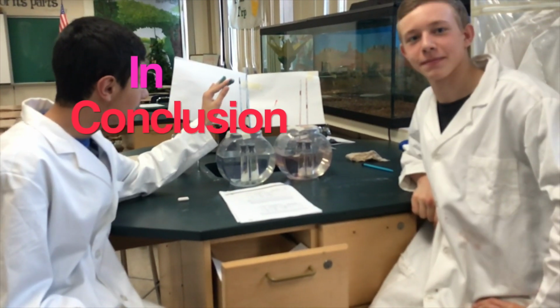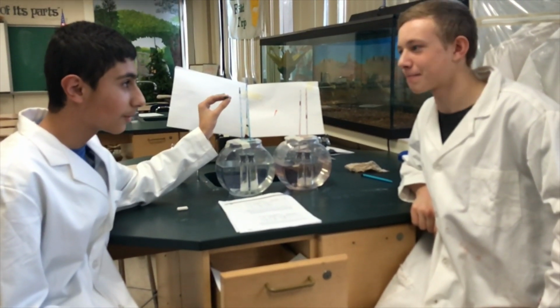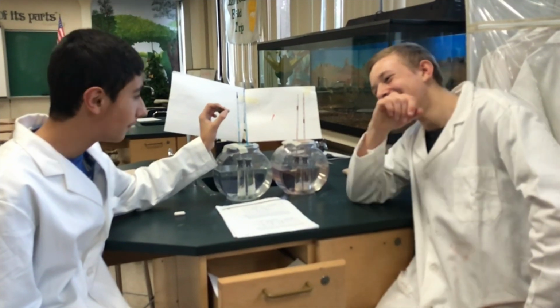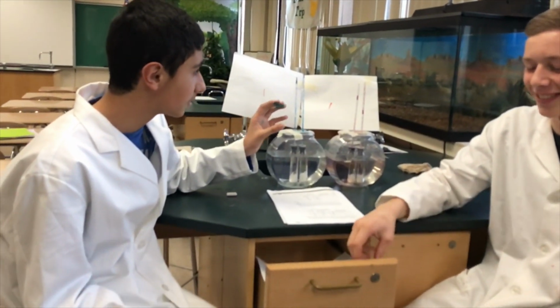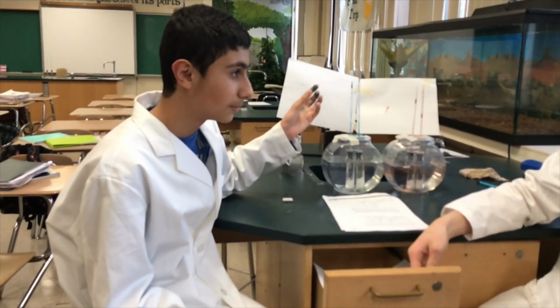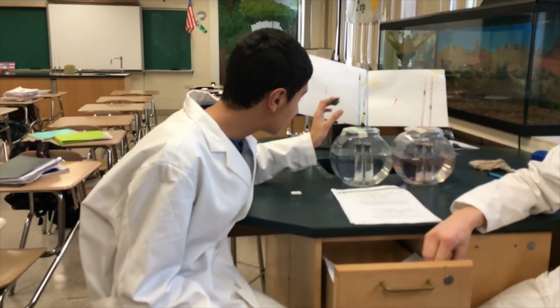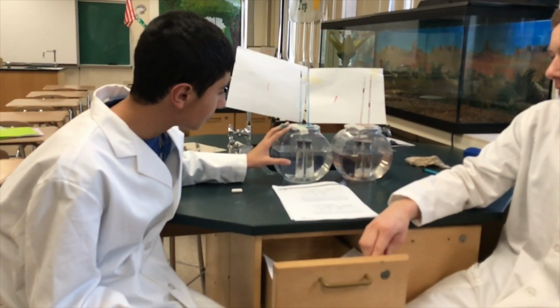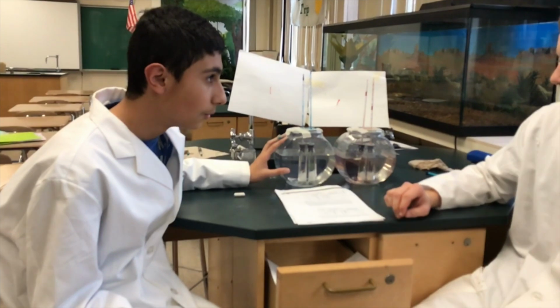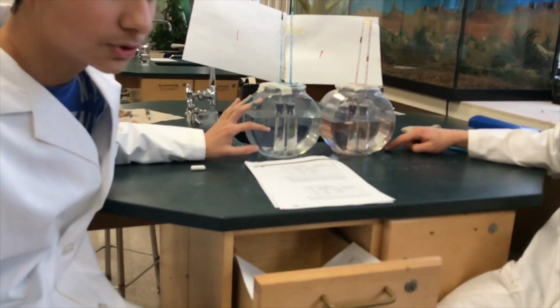The variation in food dye travel can be explained by different rates of cellular respiration. As temperature increased, metabolic activity, which includes cellular respiration, also increased, while as temperature decreased, metabolic activity also decreased. This characteristic is unique to cold-blooded organisms such as the crickets we observe today. This explanation is supported by the results of the data table.